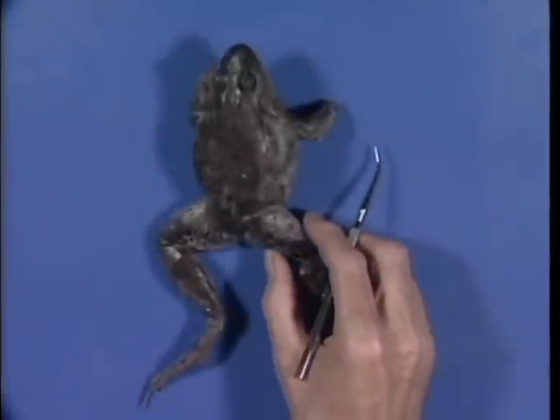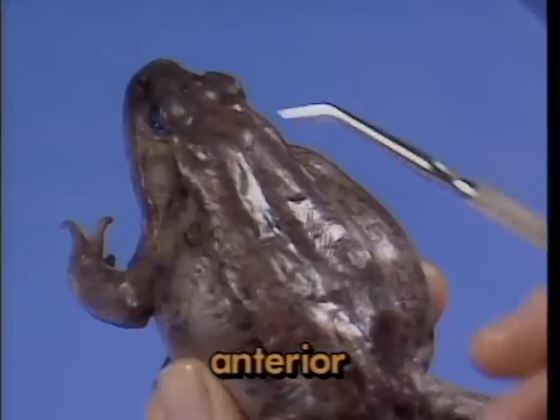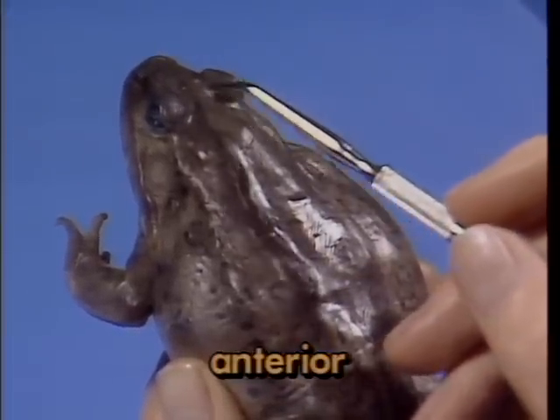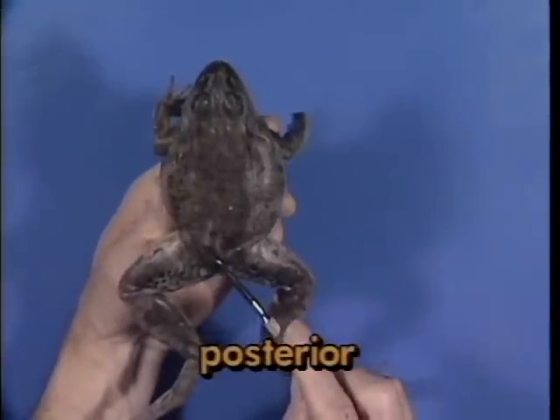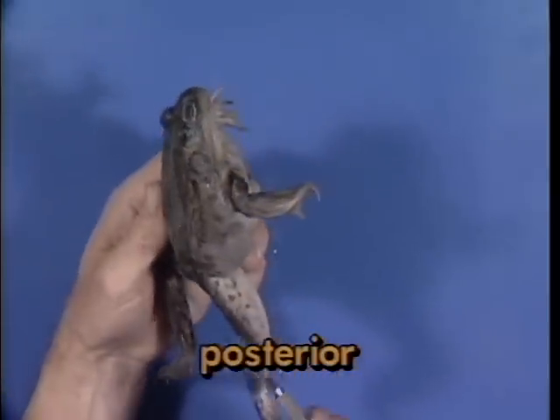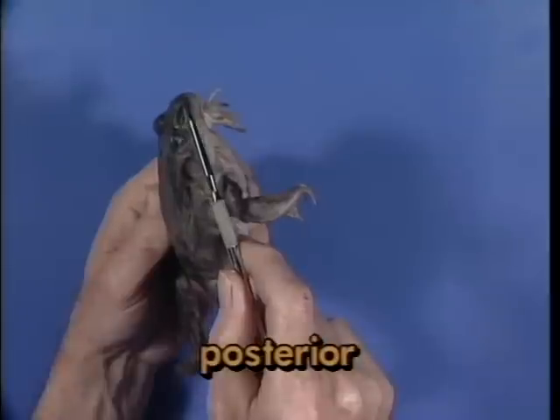Features which lie closer to the head are said to lie anterior to another feature. For example, the tip of the snout is a feature which lies anterior in position to the eyes. In the same fashion, if something lies further toward the back end, it is said to lie posterior to another feature. For example, the upper arm of the front limb, seen here, is posterior to the tip of the snout.